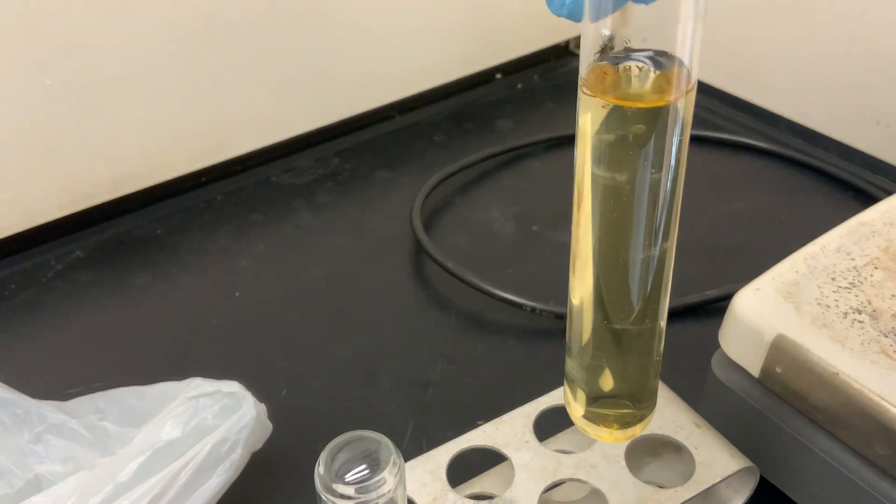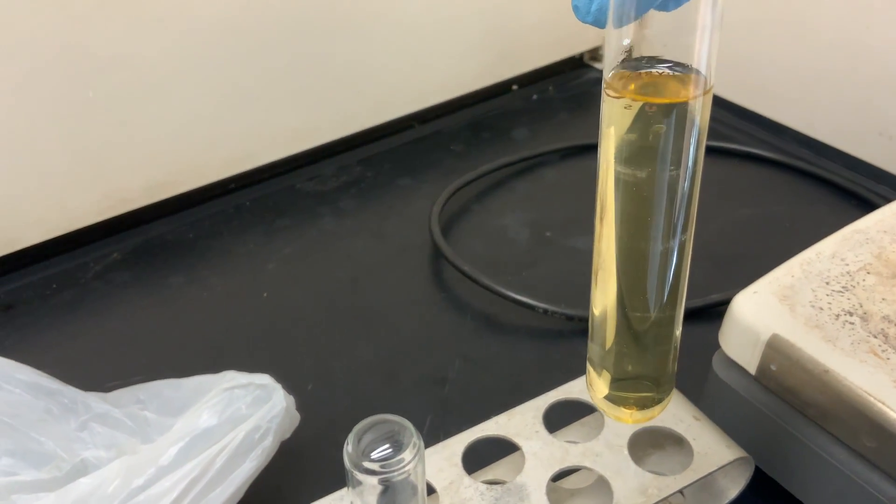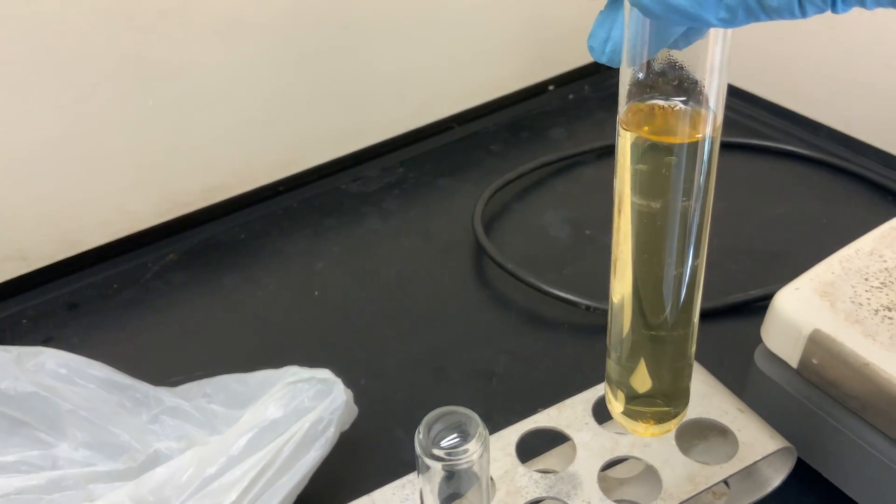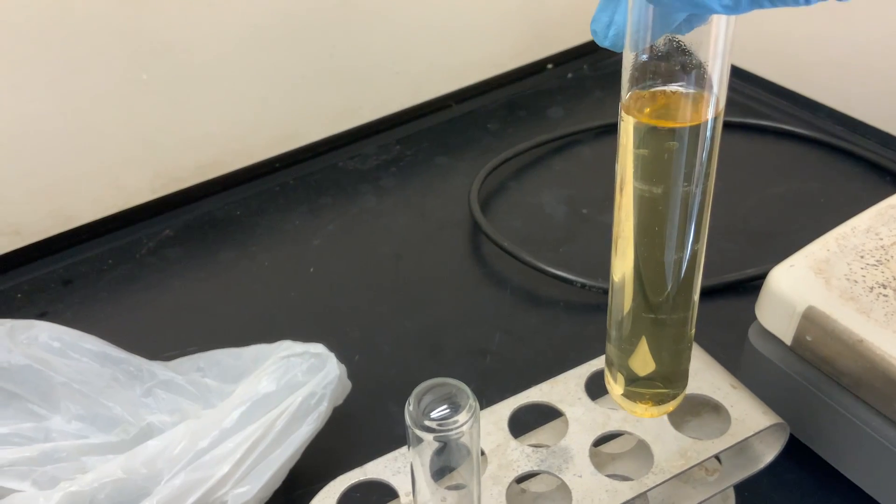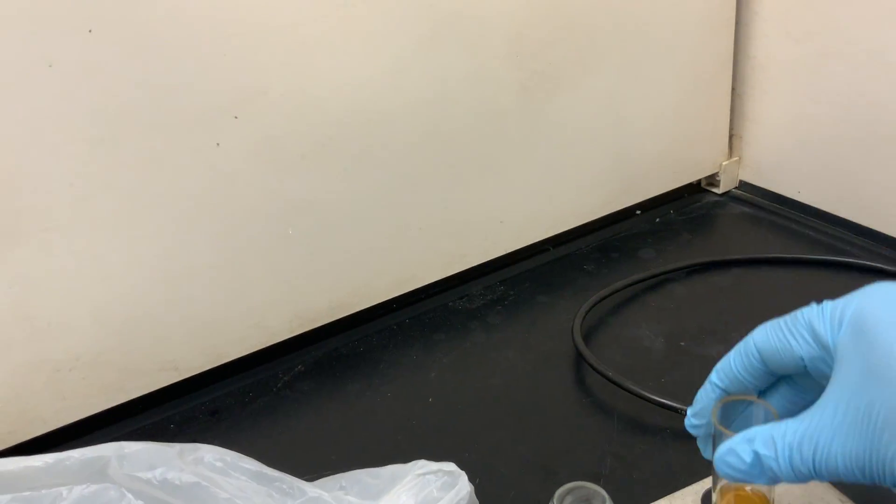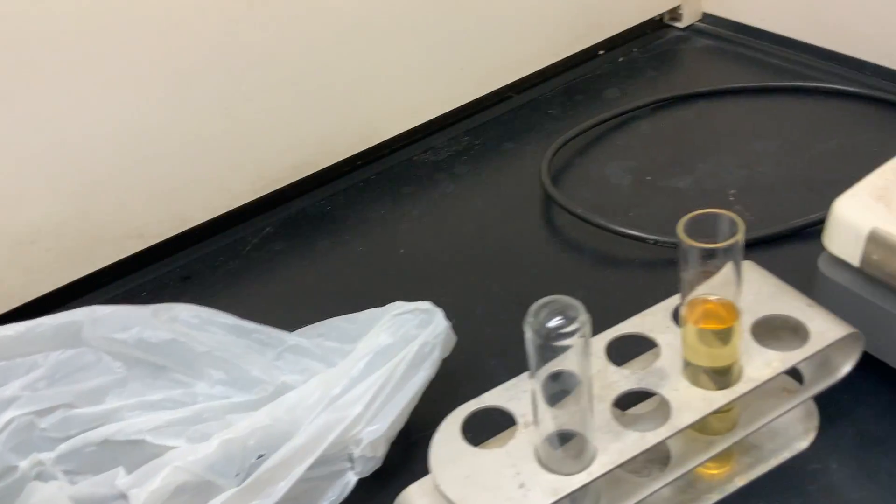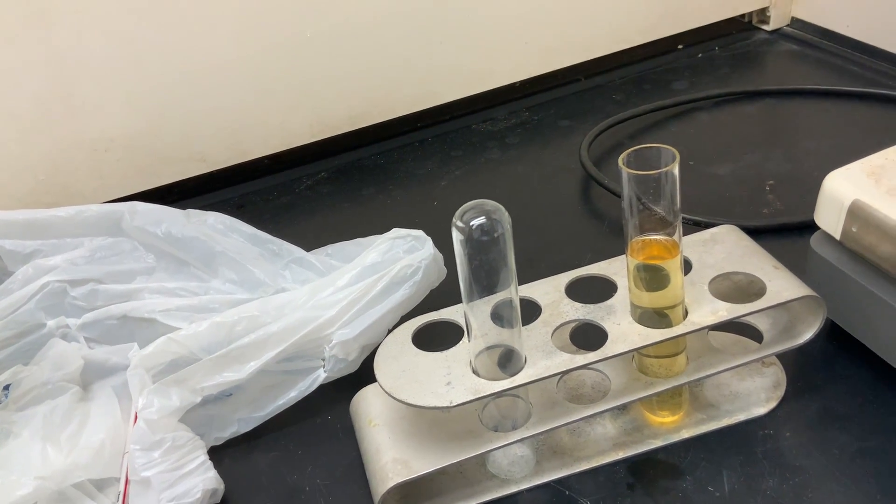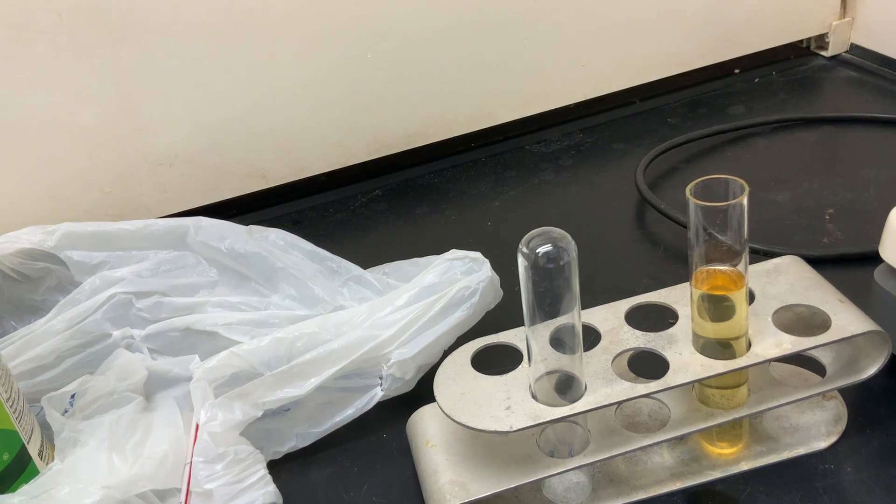Right now we cannot see two distinctive layers, but allowing it to sit for several hours it will separate into two distinctive layers. We will have a top layer and a bottom layer - the two components of the mixture.